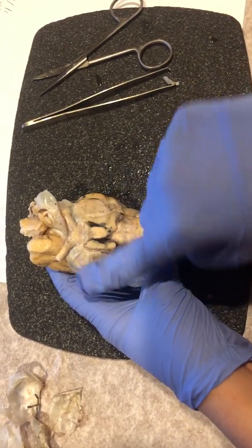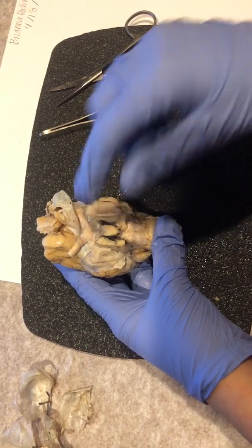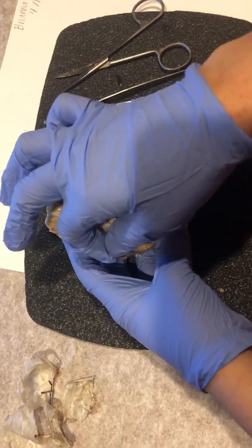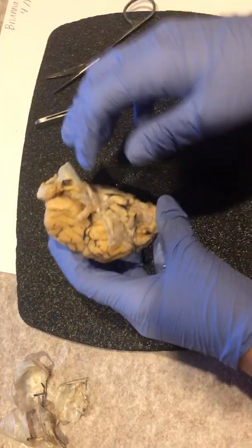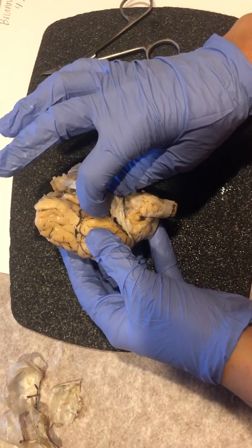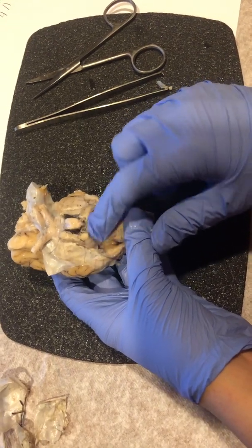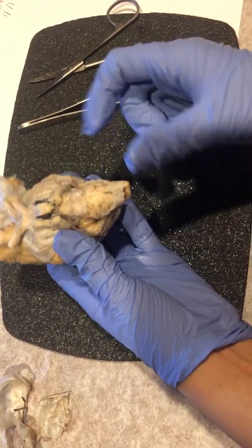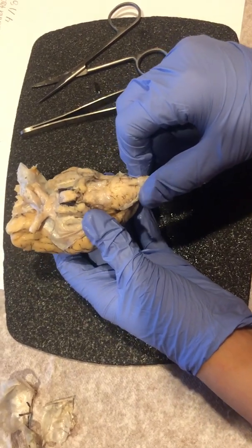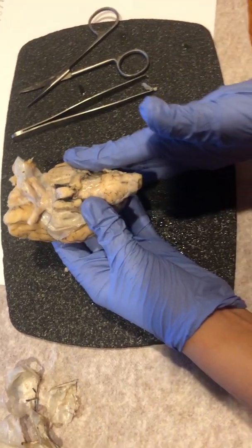And then on the two sides of the brain are the parietal lobes. And then of course, like I said before, the skin-like structure is the meninges. Right inside here is the midbrain. And below this is the pons. And then this elongated structure is the medulla oblongata. And then the structure at the back is the cerebellum.